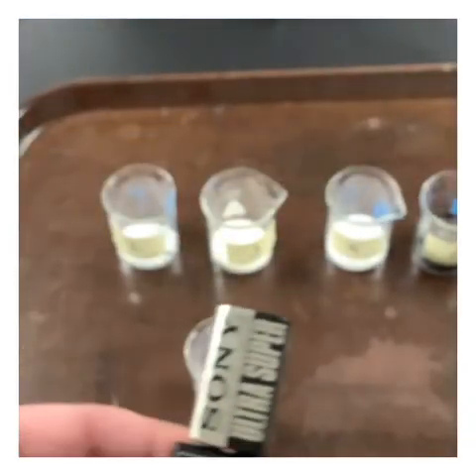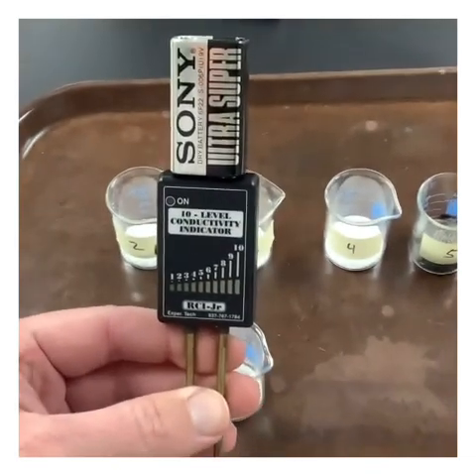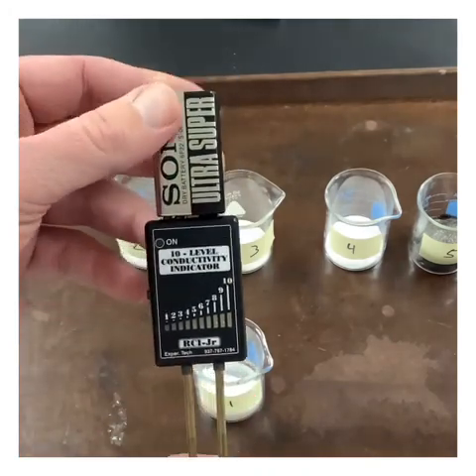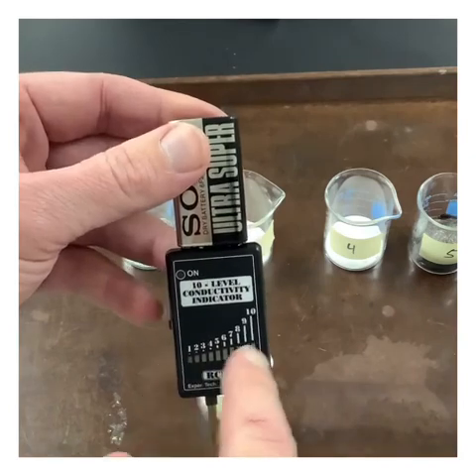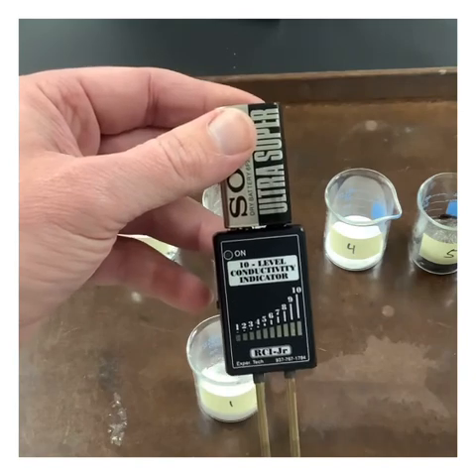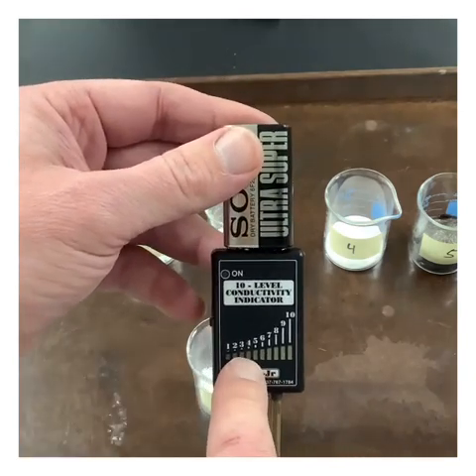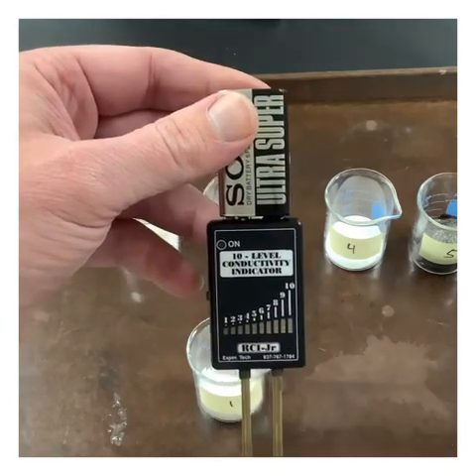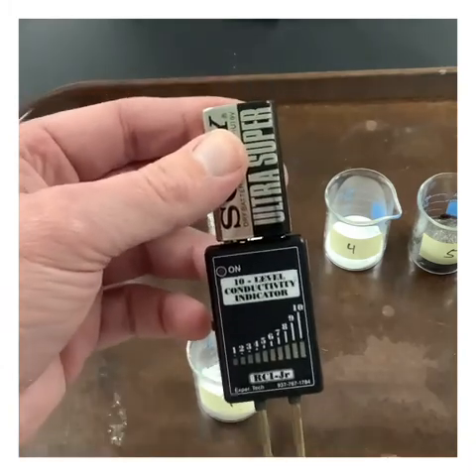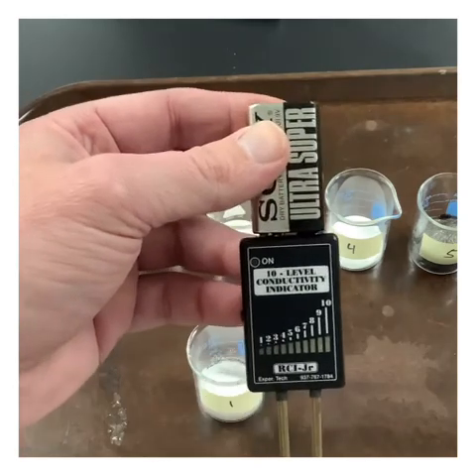To test the conductivity as a solid, we're going to be using this conductivity meter. The conductivity meter is basically going to give us a ranking. It's ranking the conductivity on a scale of 1 to 10. Typically what we find is that in order for something to be conductive, it usually wants to fall in the 3 or larger category. Technically, according to a book definition, any little bit of conductivity would mean that the substance is conducting, so even a 1 would qualify.